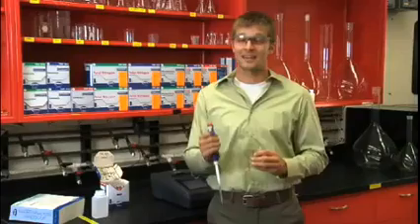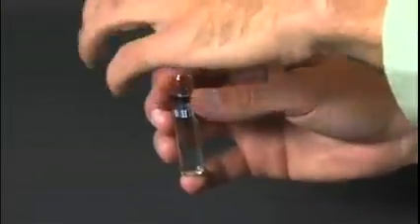Now remove the cap and add the appropriate amount of sample to your vial. Flip over the DoseCap, tighten, and shake a few times to fully dissolve the contents.